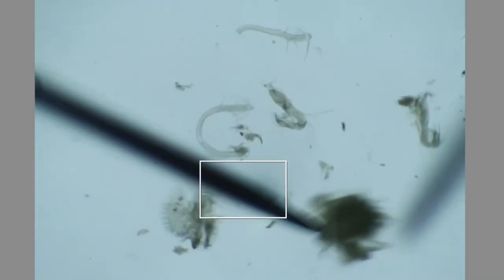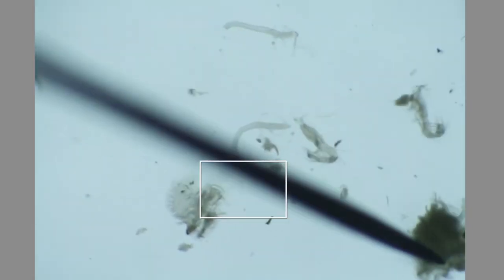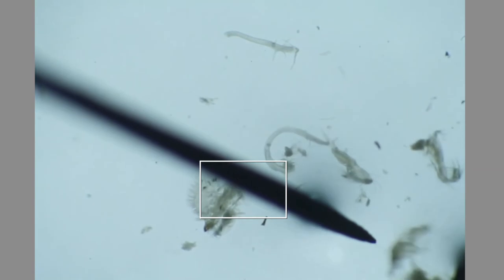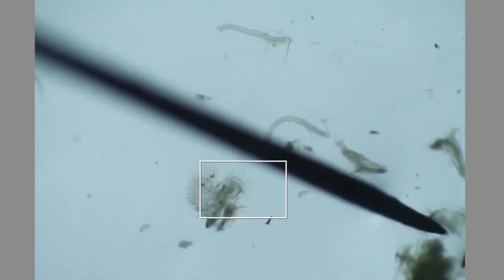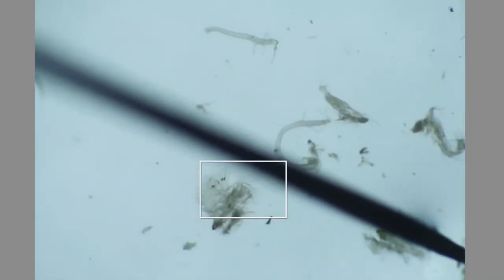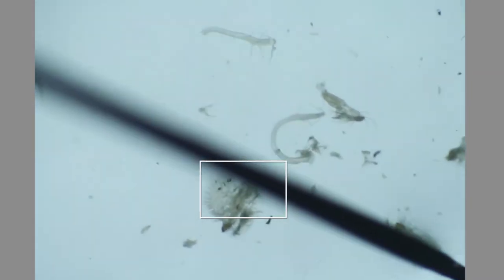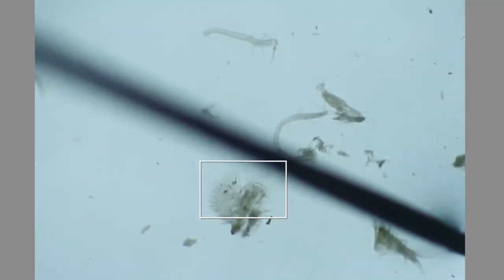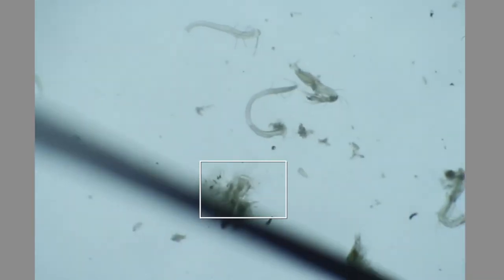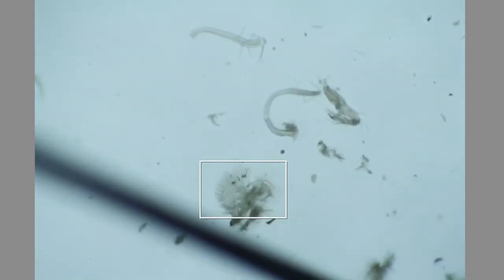This is looking pretty good — I'm left with almost nothing at all. There are some more mouthpieces here. This one's a little bit funky because it's on the older side, but even if you get an old one, you take it nice and slow and easy. You can usually get at least one of each of the limbs, if not everything.